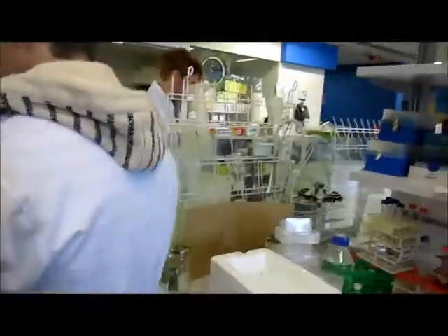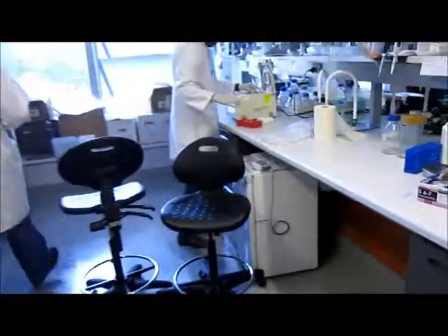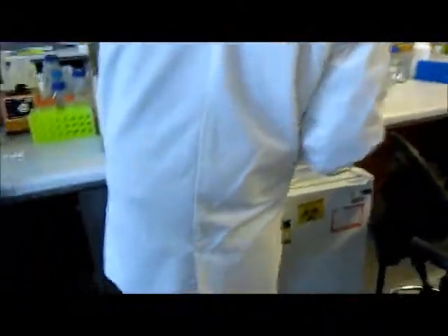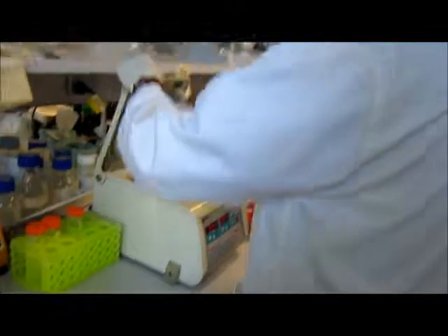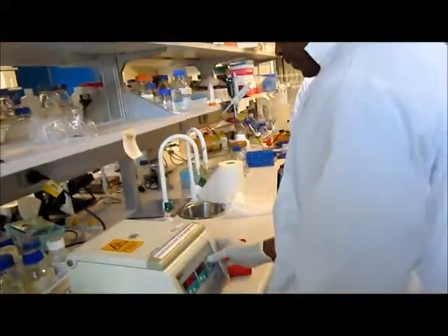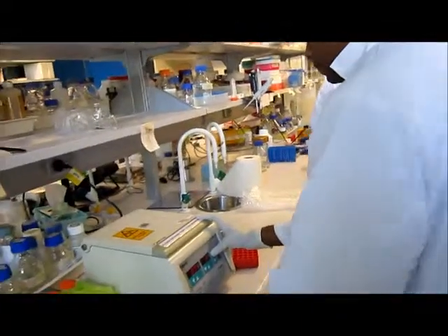So, I suppose we could go over there. For the centrifuge, do we need to change the settings or do we just put the tubes in as it is? It's a good question, so we should ask. Whenever you do the spin, make sure it's balanced. We have 4 tubes, so it's easy. I'll just give it a pulse.